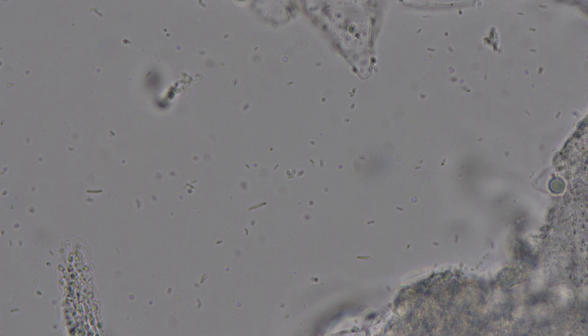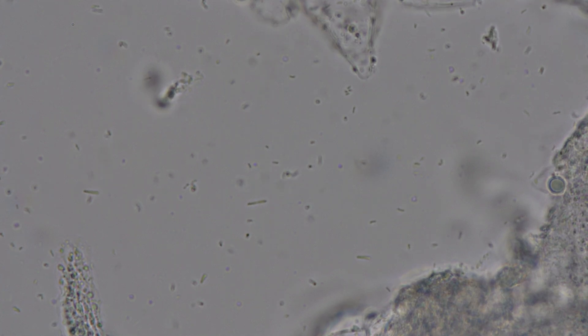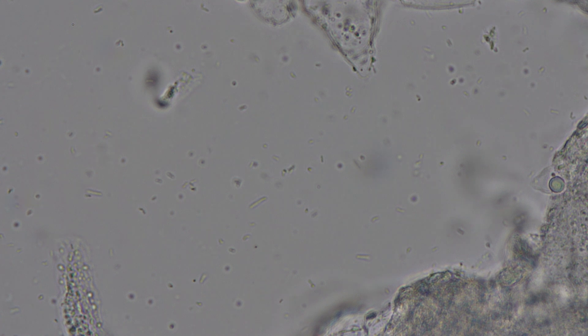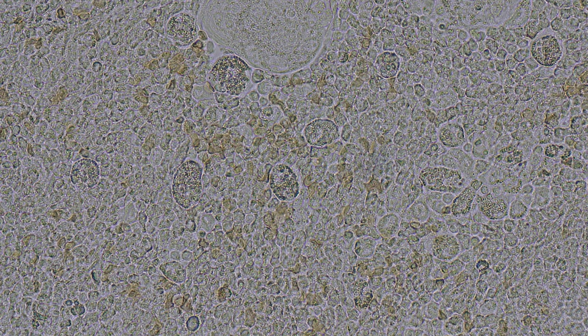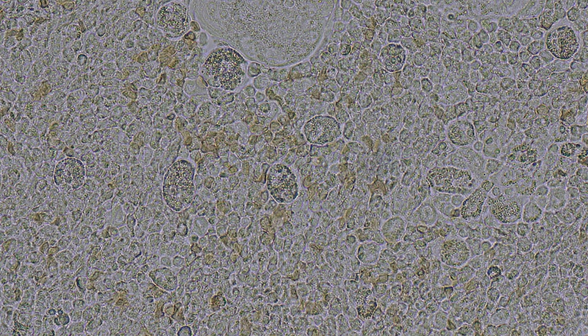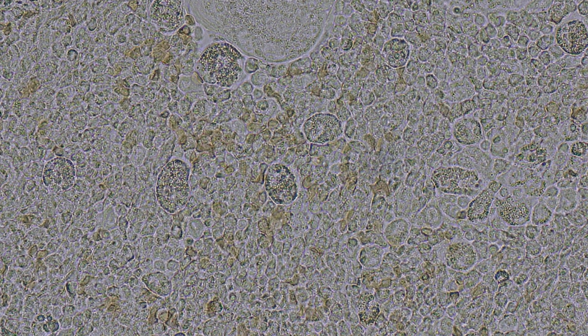Under the microscope, the core of cystic acne is not much different from inflammatory acne — the cause is the same. Sebum and dead skin cells clog pores, creating an environment for Cutibacterium acnes to thrive, triggering the immune system, forming pus, and causing swelling, redness, and pain.